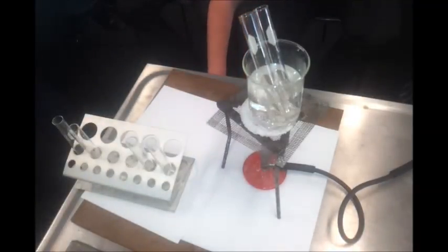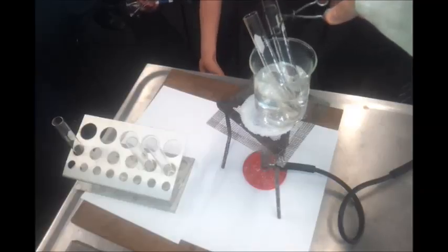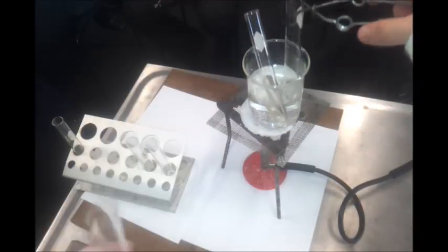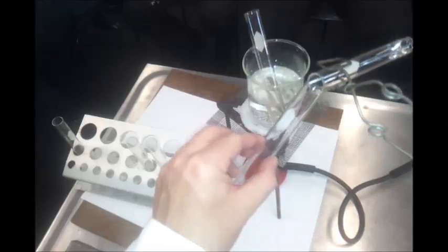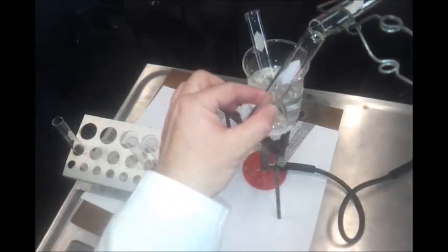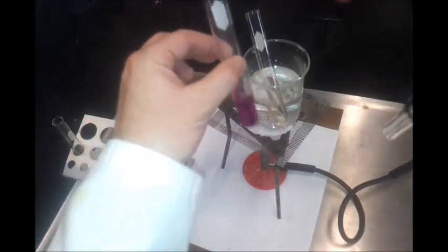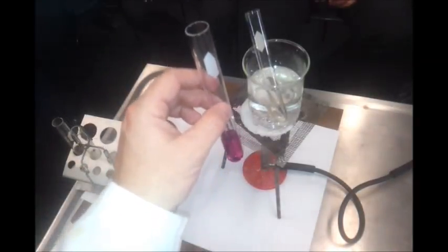Right, there we go. Okay, so my first one is going to be adding it to the purple permanganate. We'll see if there's anything that happens here. Okay, give that a wee bit of a shake. Probably got a bit much permanganate in there, to be honest, for this to go well. In fact, someone said I should have done it the other way, and they were quite right. I should have gone with permanganate into that.